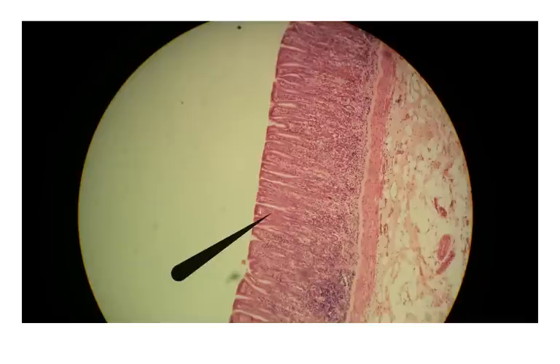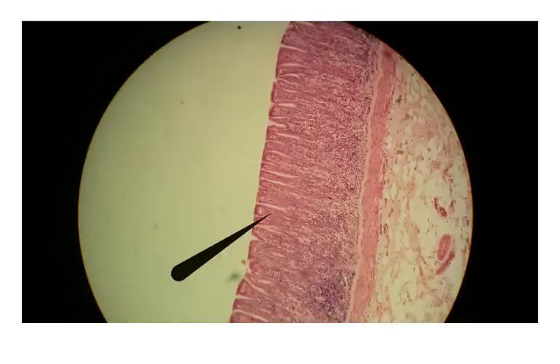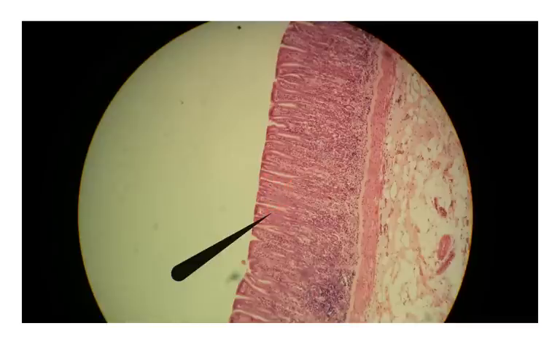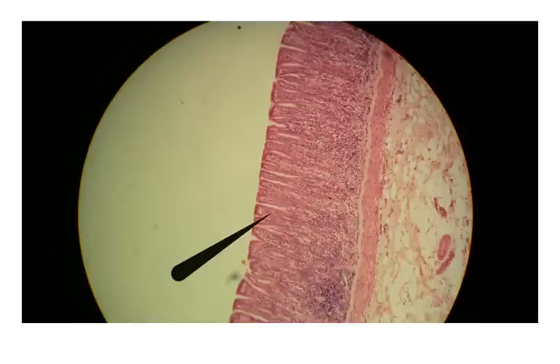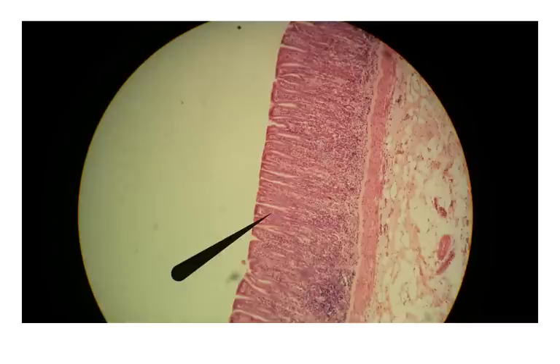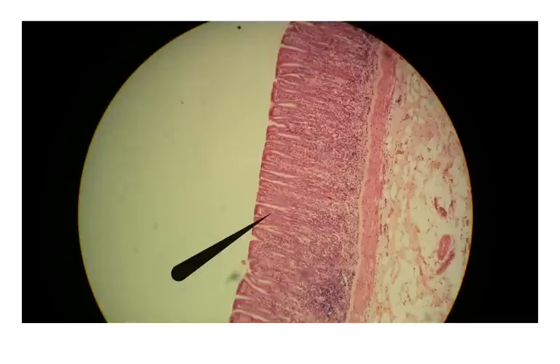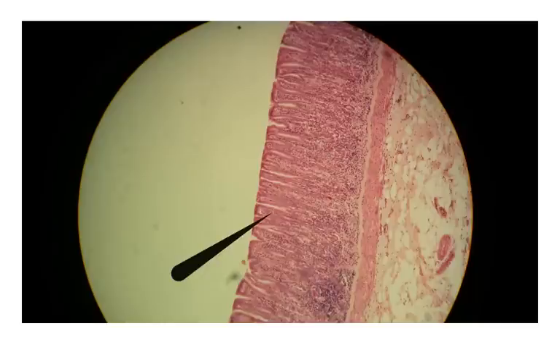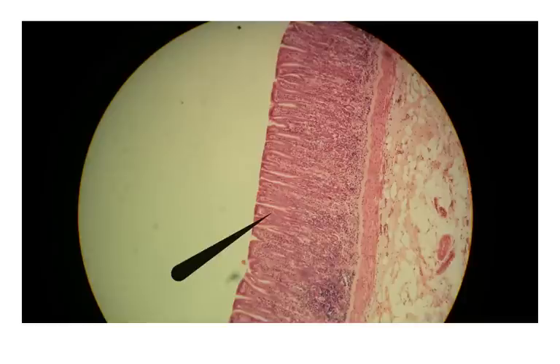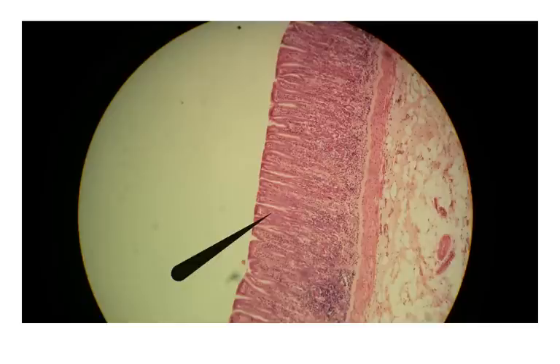Let's compare that to the stomach, which is difficult to identify at this magnification. Here we have these sunken-in areas called gastric pits. These gastric pits are lined with simple columnar epithelium, which is responsible for making and secreting the acid and enzymes that digest food in your stomach. You can go to the Facebook page and zoom into those gastric pits to see the simple columnar epithelium.